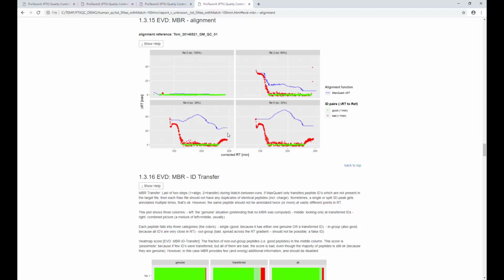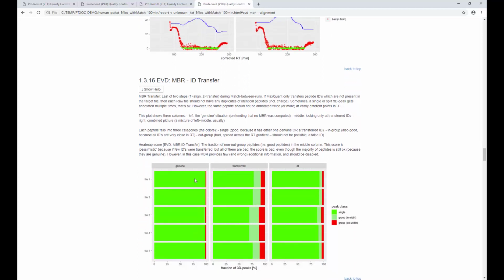And the question is now, how much harm does it actually do to transfer identifications which are apparently off by more than a minute or so? And the answer is right here in the next metric. So you can basically judge how severe the problem is, and what is the gain and what are the potential false positives that you're including here, which will obviously have an influence later on your peptide and protein quantification.